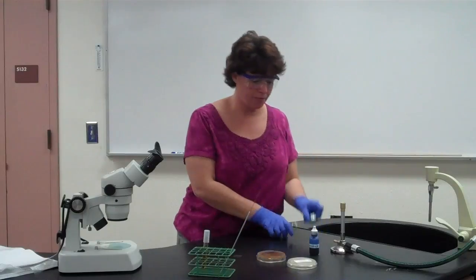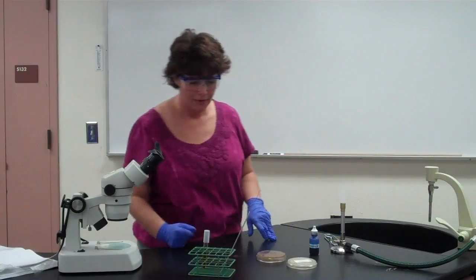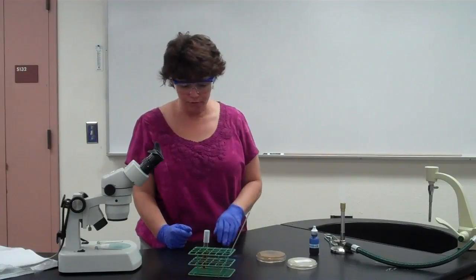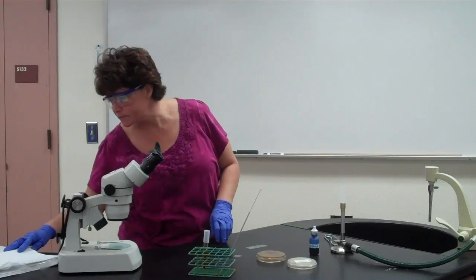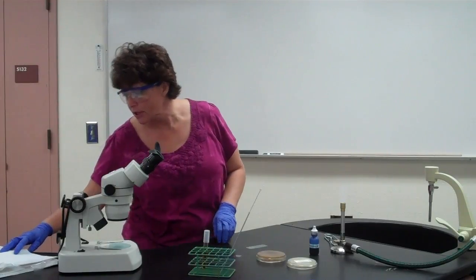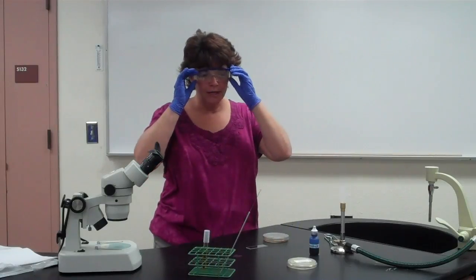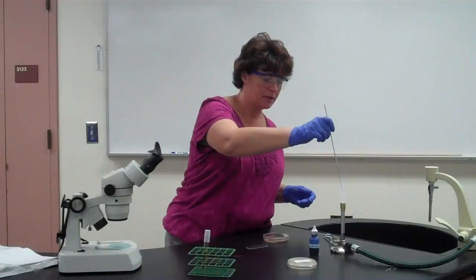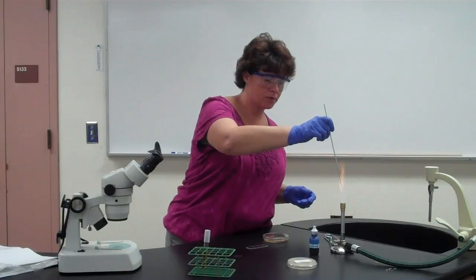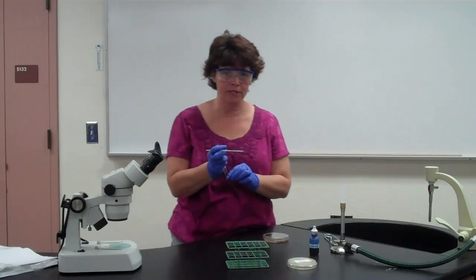Okay, as we always do, I'm going to get the flame ready. This time it's not falling over. Okay, so for the part with the flame, for the first procedure, you're going to be putting it on the plate, and you'll notice that it says not to spread it or anything. So what you're going to do, now we're going to assume or hope or pray or wish, whatever the word is for it, that the mold actually grew.